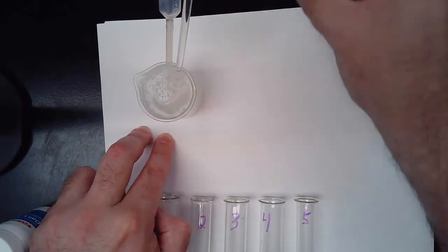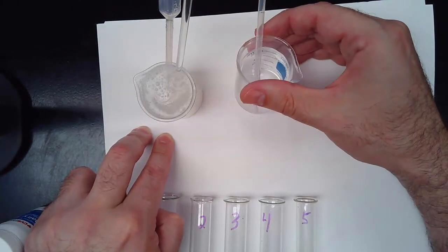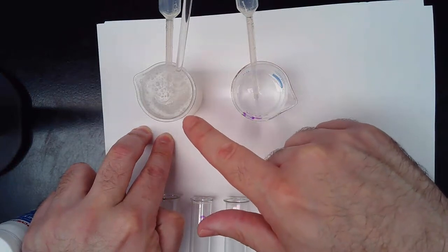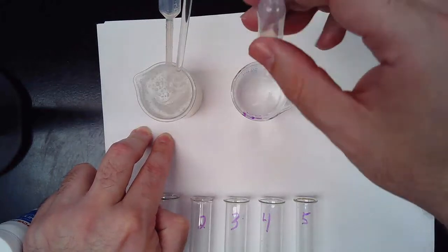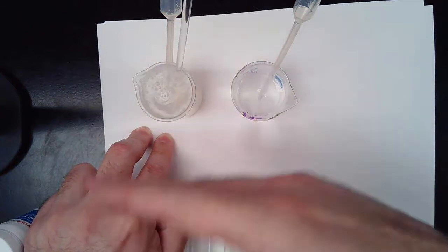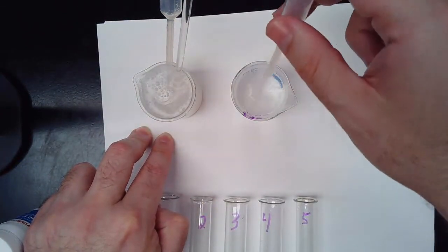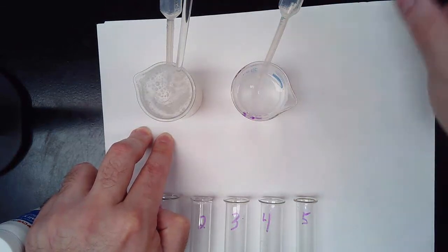Next, we have some denatured enzyme. It looks a little bit the same, just a little bit cloudy. What I did was take this and boil the living daylights out of it. In other words, I exposed it to a large amount of heat over a long period of time. You can see some of the fuzz up here; when you boil it, I scraped off the fuzz so you could see things a little easier. But that's all this is: enzyme that has been heated to a relatively high degree.